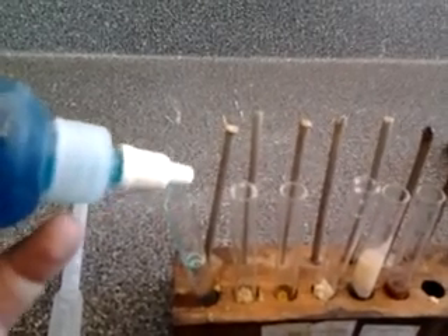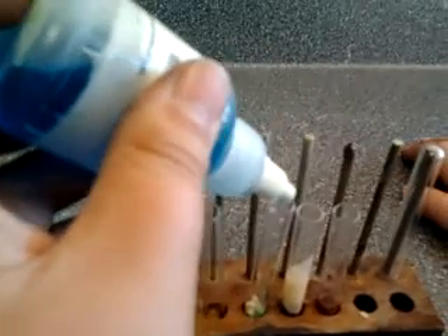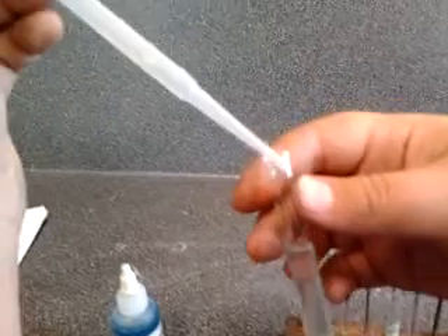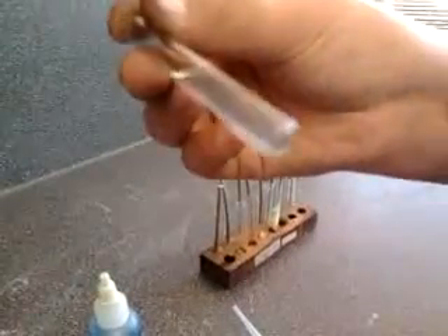What's the prediction of what we have to do? So the glucose solution's almost got no sugar in it, as it's clear.